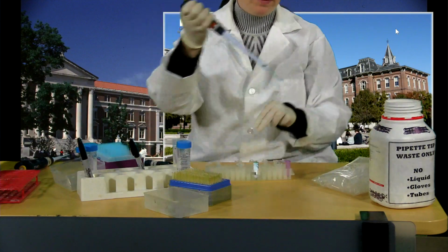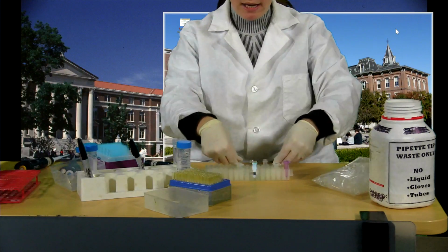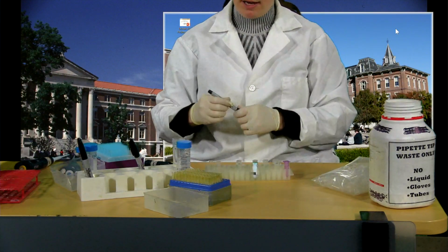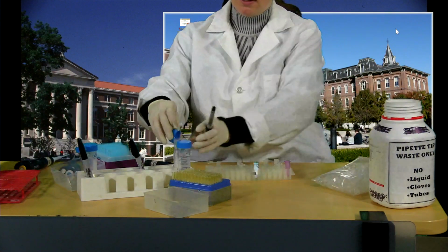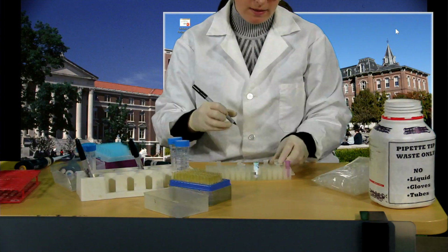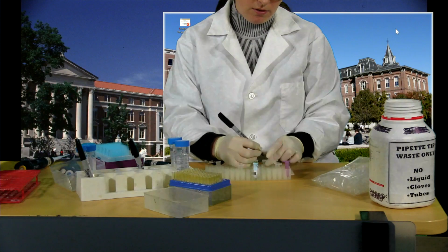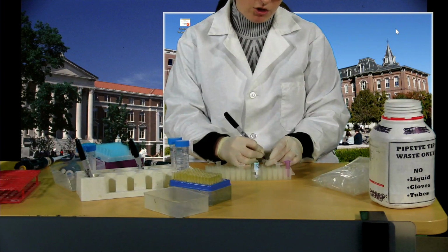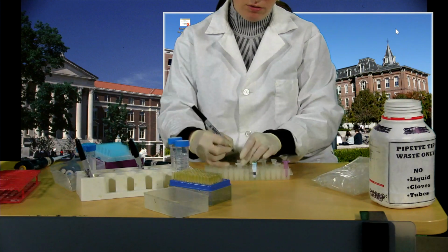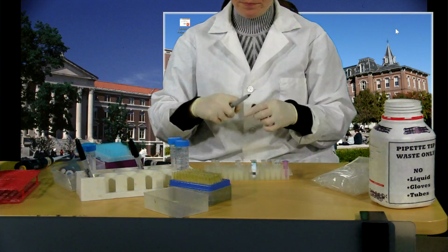Okay, here we go. Now before I put my fractions in here, I'm going to make sure to label things up. It's really easy to get distracted for a second and to just forget what went where. Let's put the lid on this substrate so we don't spill it. Okay. Just going to label these with the purified fraction, and then 10 diluted, crude, and the crude, 1 in 10.